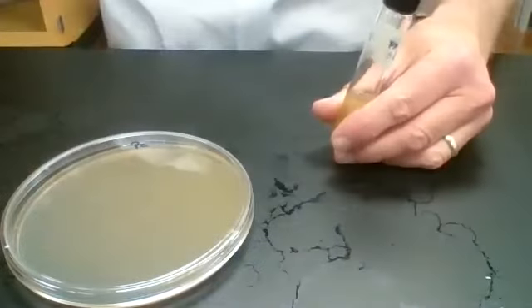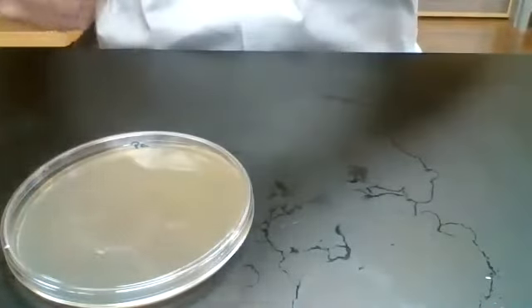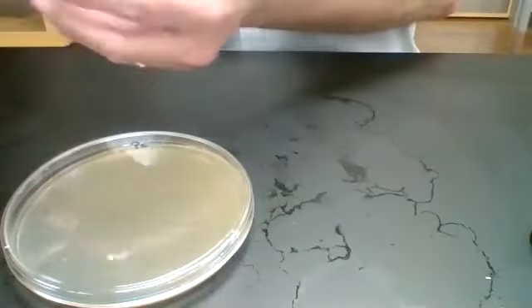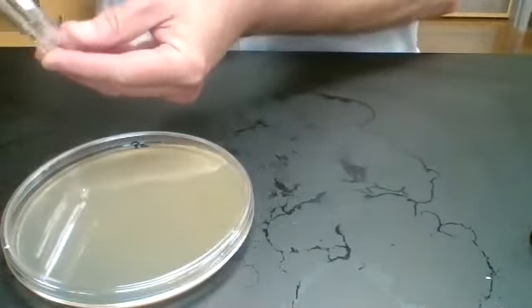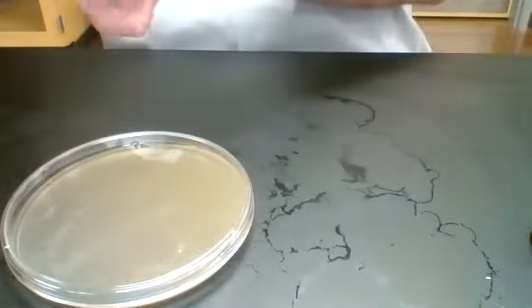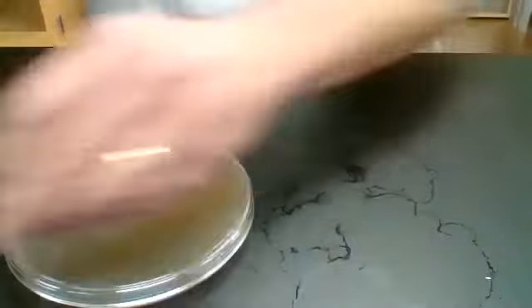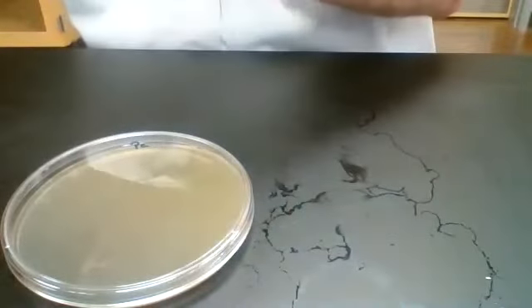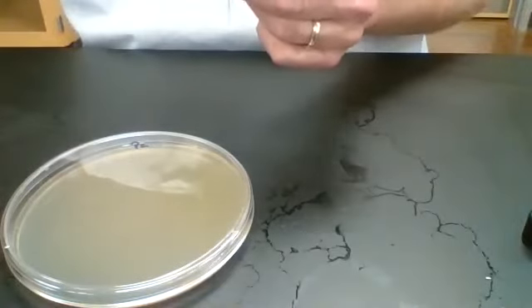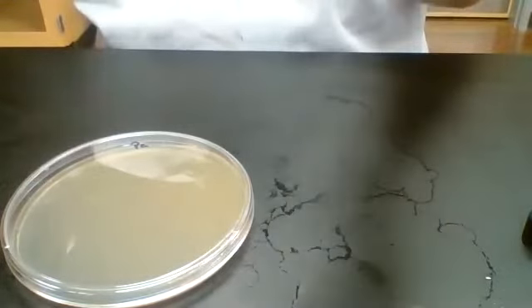So I've got my Pseudomonas aeruginosa culture, and I've got my sterile swab. Okay, this time I'm not going to pour culture all over the bench like I did last time. So we just simply get our swab out, if it will come out. They always get stuck. There it goes. We can replace the tube. Okay. Then I open up the Pseudomonas aeruginosa, flame the top. Sorry, the Bunsen burner is out of the shot, but you can get the idea.